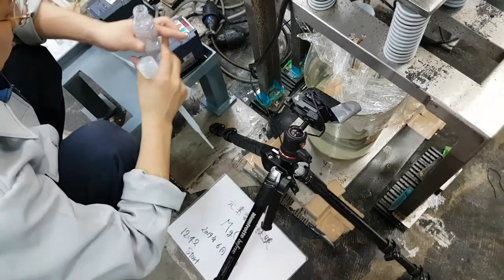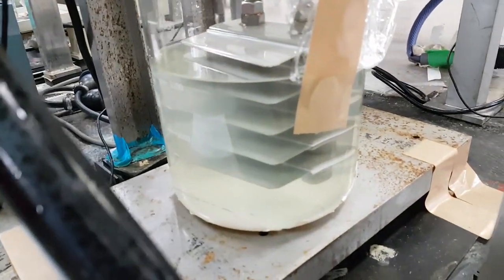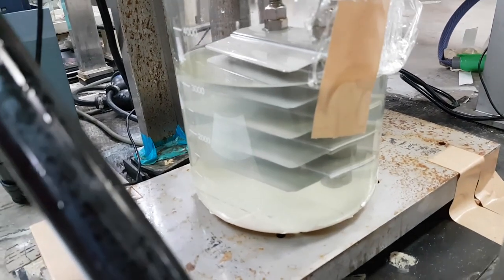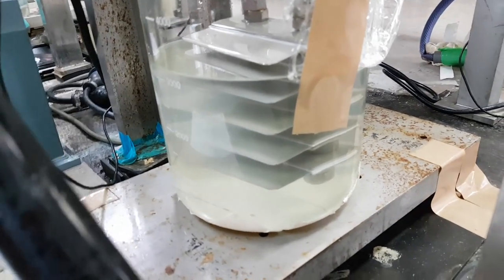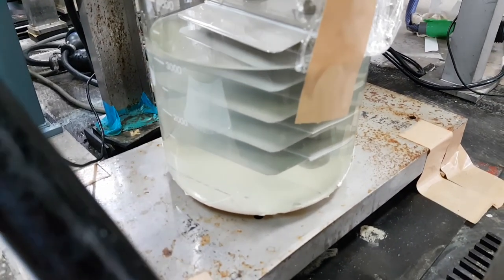So apparently it took about 20 hours to change this from the clear to this sort of yellowy color. It's yellowy green, I guess.